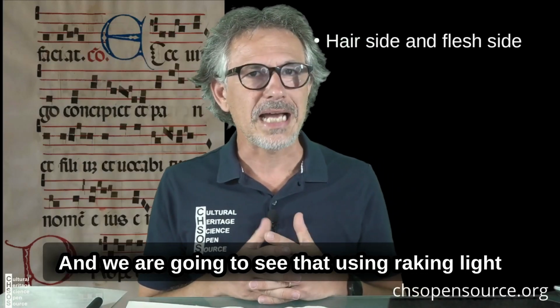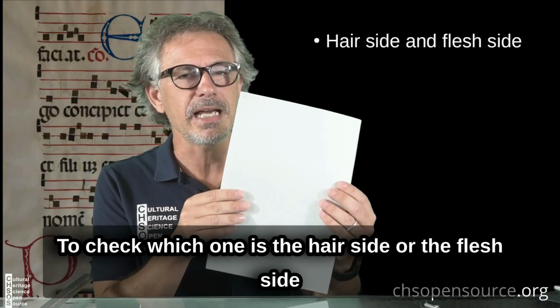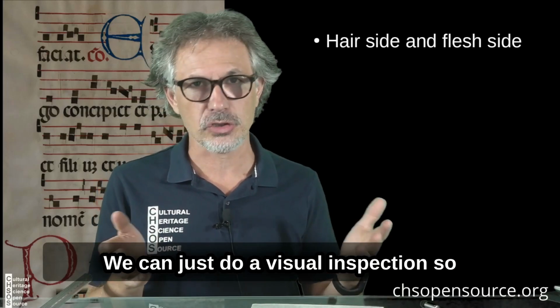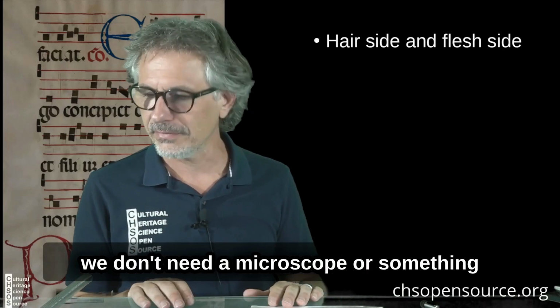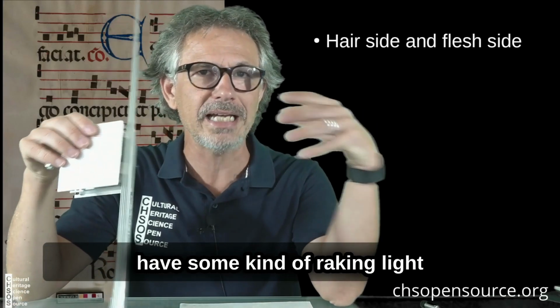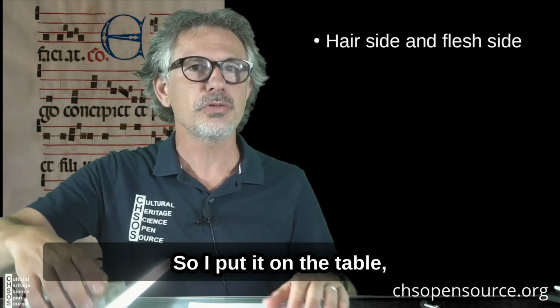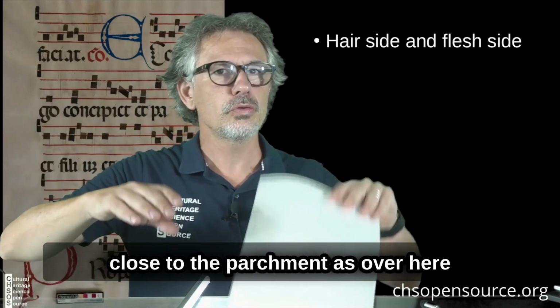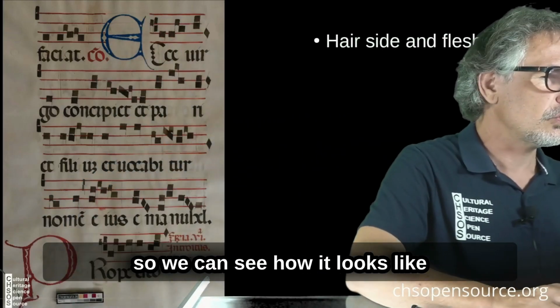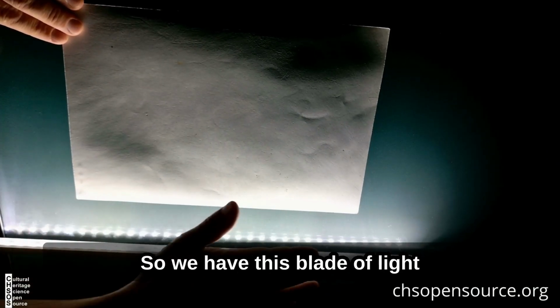We are going to see that using raking light to check which one is the hair side or the flesh side. We can just do a visual inspection, so we don't need a microscope or anything. It's nice to have some kind of raking light system. I use this one in my lab, a blade of light. I put it on the table close to the parchment, like over here, and we are going to use another camera so we can see how it looks. Okay, there it is. So we have this blade of light over here.